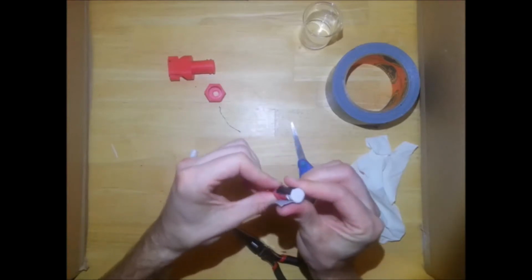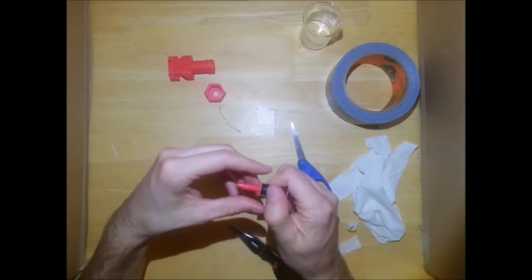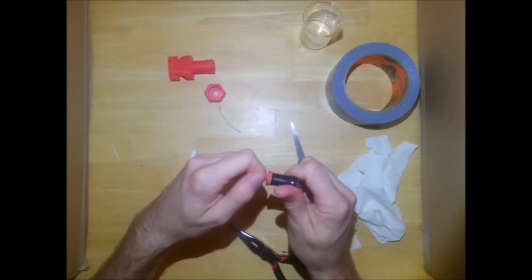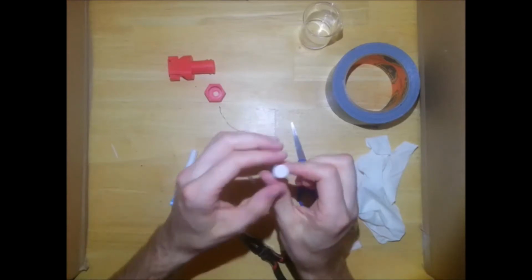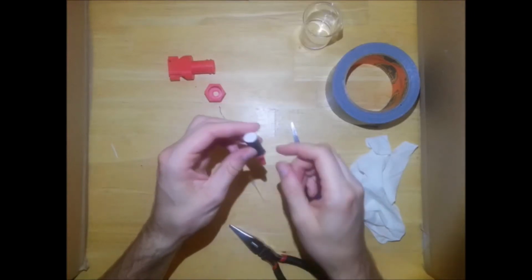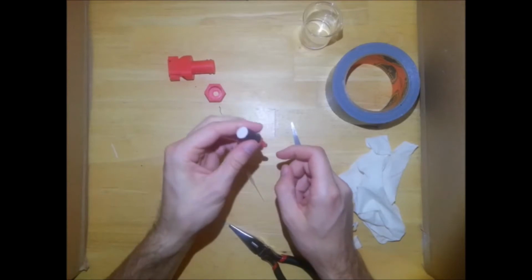And then carefully wrap around. Make sure that there is a solid connection between both the tape and the plastic, and the tape and the rubber glove. And this is the part that actually makes your airtight seal. So the wire doesn't actually contribute to anything except to keep this top part flat while you tape it.